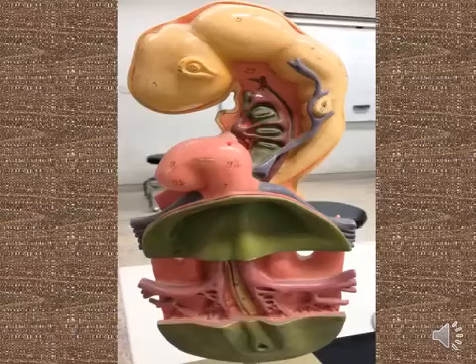Also these sections show the heart loop. The heart tube has four parts from anterior to posterior: bulbus cordis, ventricle, atrium, and the sinus venosus. These four parts bend, forming the heart loop. This is the heart loop. In these sections this is the atrium, the ventricle, and the sinus venosus.